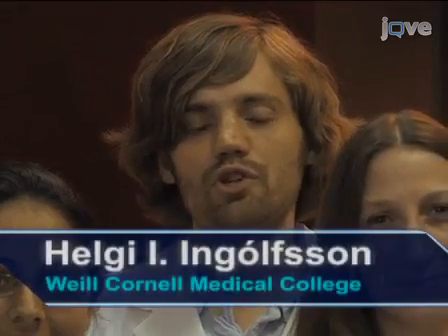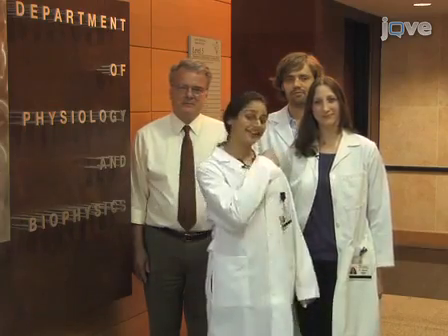Today we'll show you a procedure for measuring changes in lipid bilayer properties. We use this procedure in our laboratory to study the effects of drugs and small molecules on lipid bilayer properties. So let's get started.